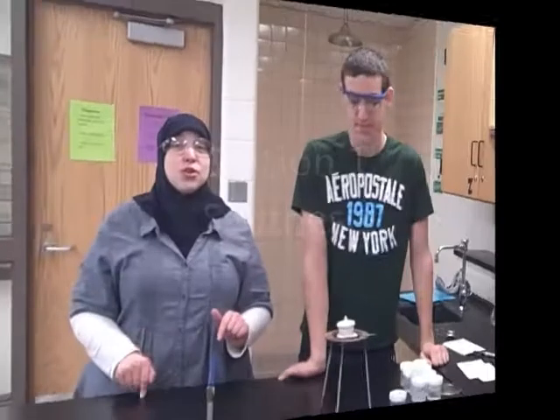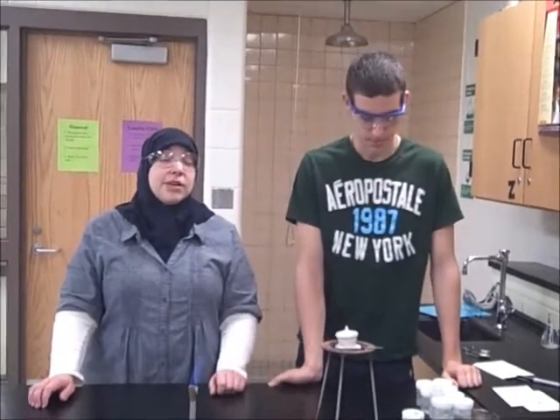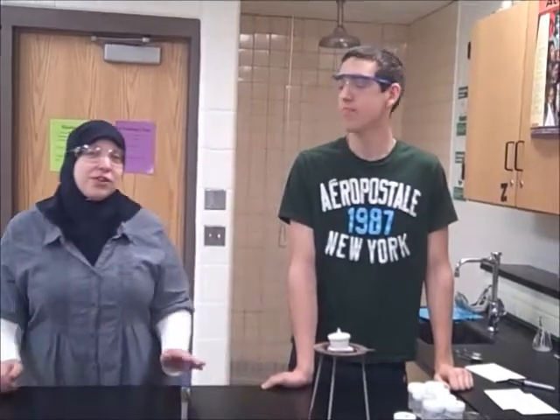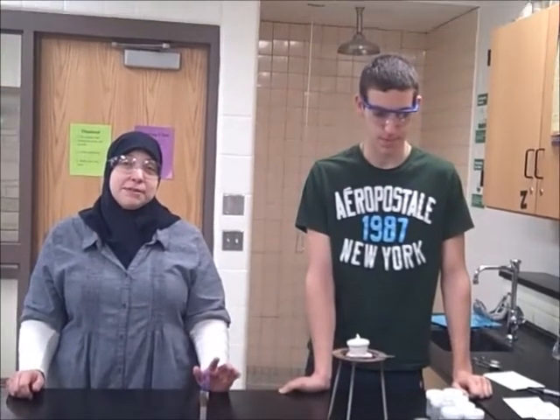So this is the Goal 6 lab write-up. This is going to be types of chemical reactions. And I am Mrs. Otri, and that is? Nick. Okay. So we're going to start off with the first type of reaction, which is a synthesis.